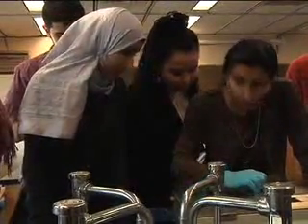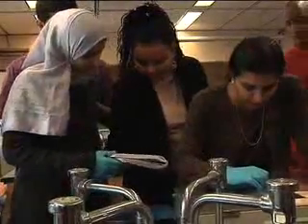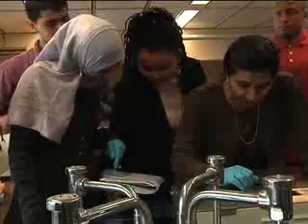Okay, lane number one is... who is lane number four? That'd be... no, lane number five. Lane number five. Me. Jin, you are negative, negative. And Miriam, you're the variation in this group. You have one Alu and no Alu, so she has a heterozygous phenotype.